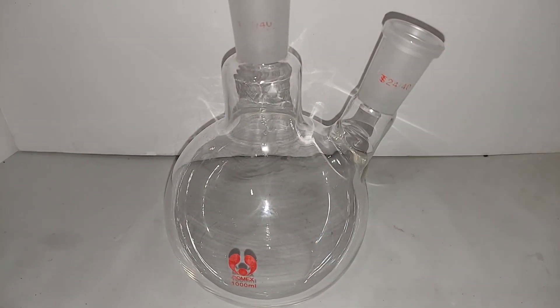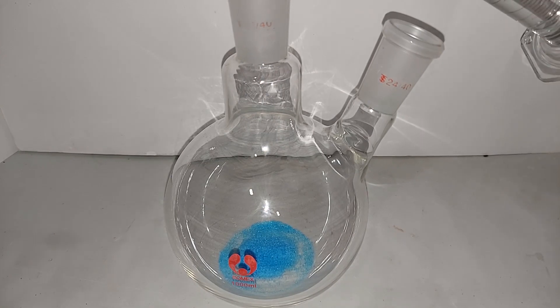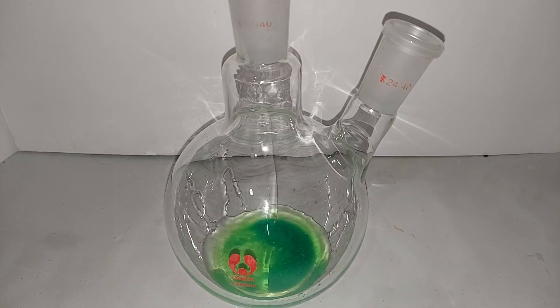I have the five grams of copper sulfate pre-measured, adding it here to the round bottom flask, then the 40 milliliters of 15% hydrochloric acid. You'll notice you get a greenish-blue color — more green than blue.